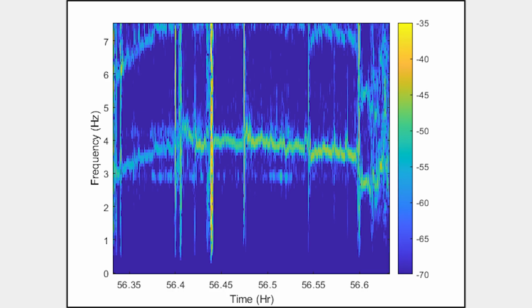In general, noise from mechanical vibrations will typically be at a constant frequency, while biological variations like respiration will vary over time. Since we did not see these noise points on the bigger timescale view, it appears less than the actual breathing signal in the finer timescale view. This would be considered good signal quality, and the vigilance state detection algorithms should work as expected.